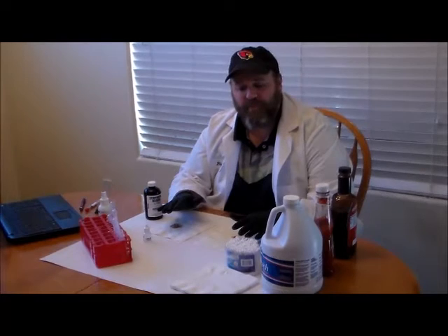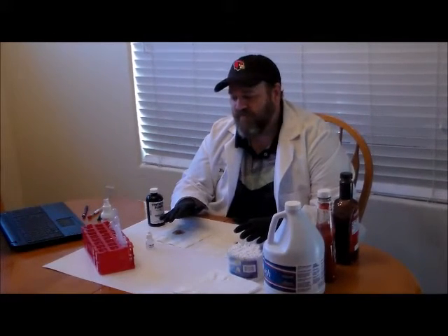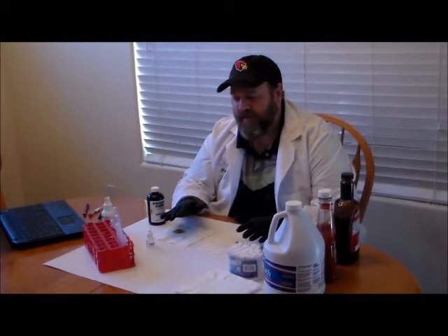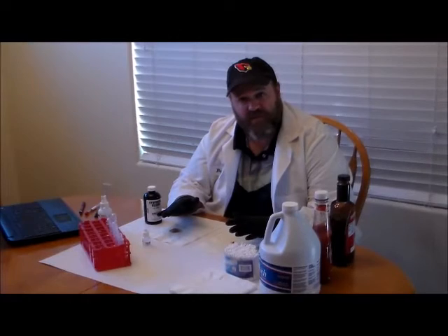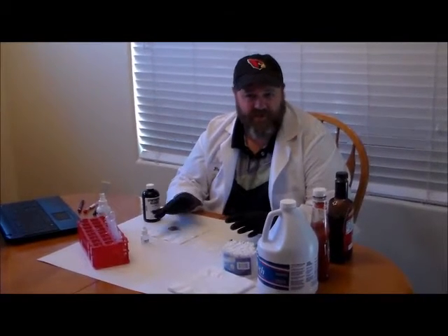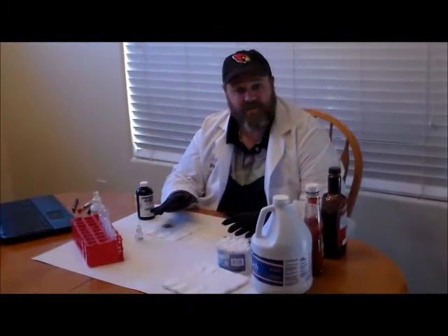For example, rust — if you test rust using the phenolphthalein reagent or the leukomalachite reagent, which are both used for the identification of blood, rust actually tests positive even though of course it's not blood. So the point of this exercise is for you to first see how the tests work, but also to identify some substances that might give a false positive.